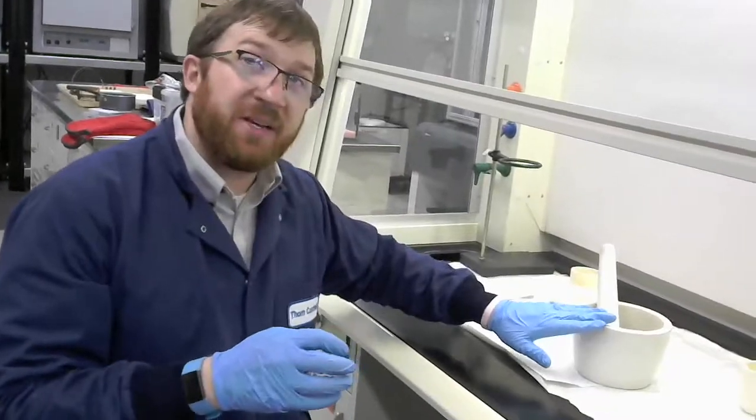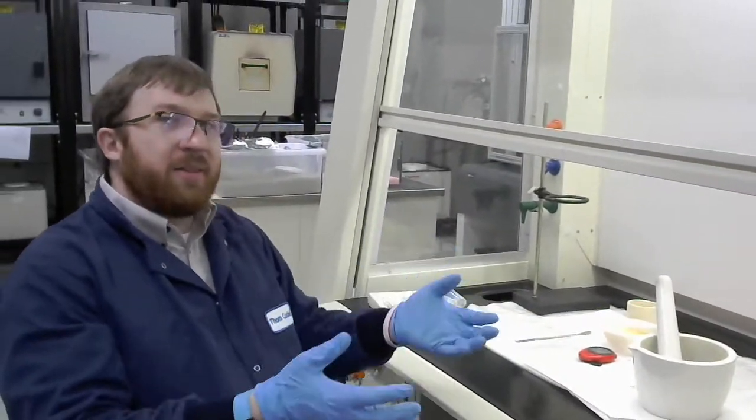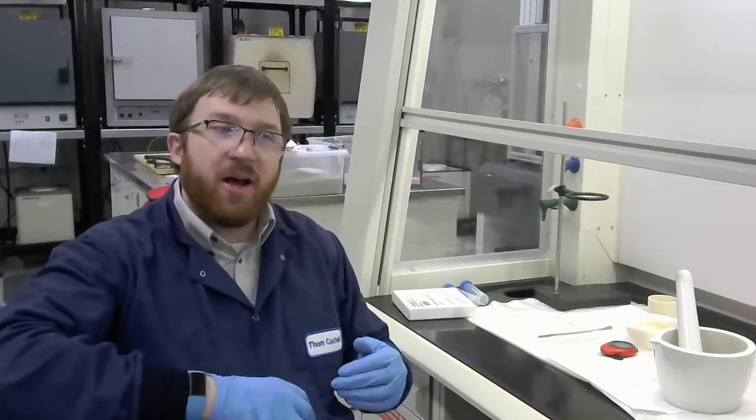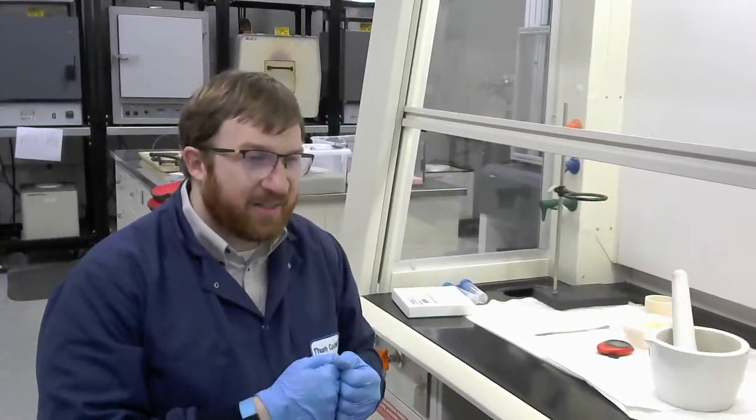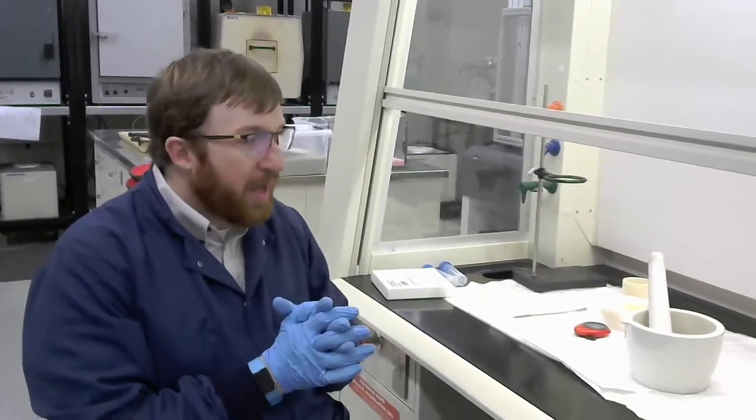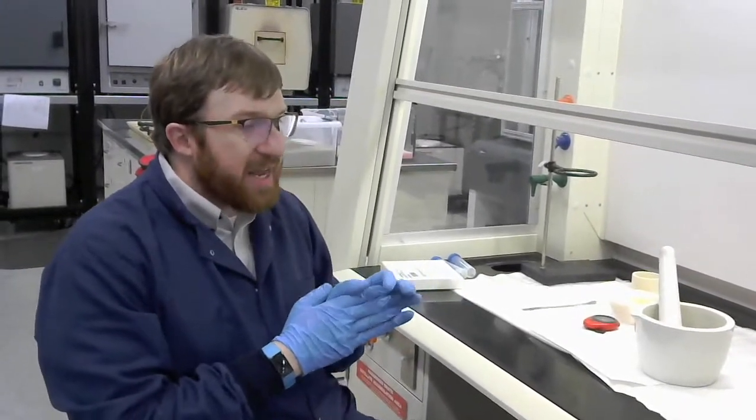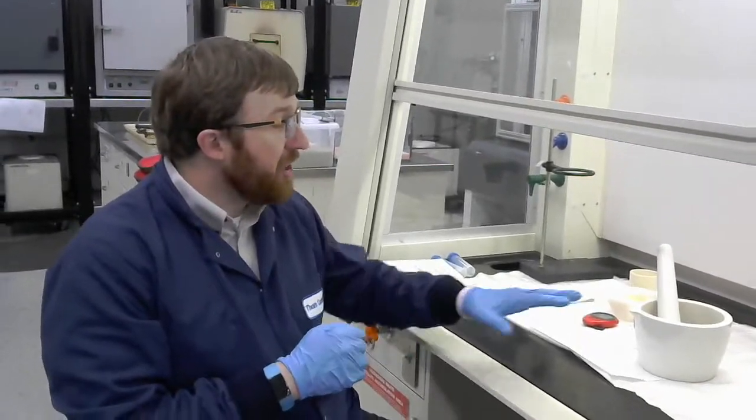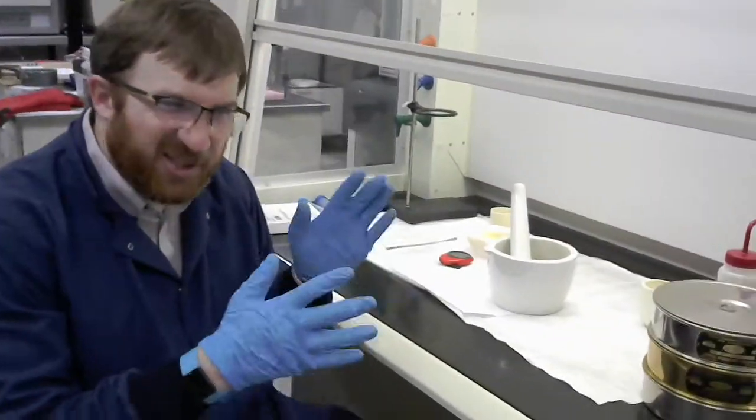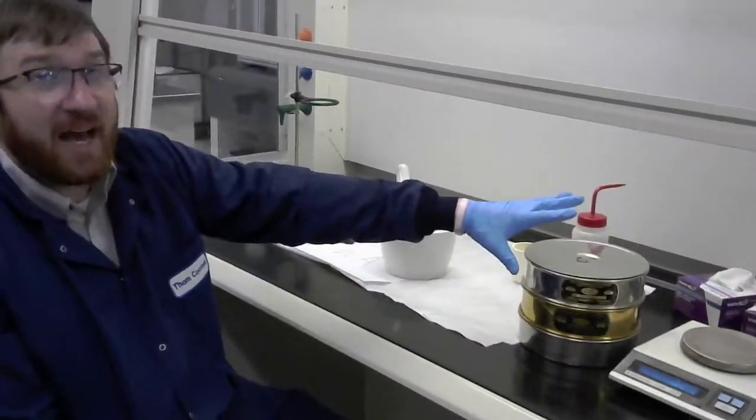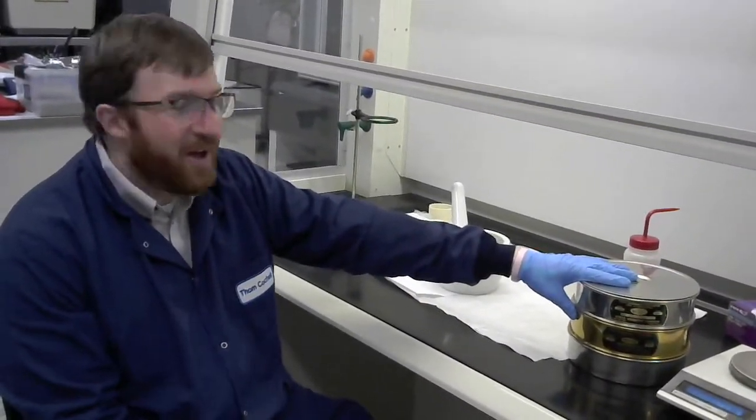And this is kind of just again from experience of knowing what level I'm trying to get down to in the powder. So typically if you see those sparkles, you still have a little bit to go. But I thought it would be a good time to stop here because this looks like probably the first part where we have some fraction of the powder that is down to size. So it doesn't all happen at once. So this is a time we'll take to see what we have. So I'm going to stop now. I think I stopped the stopwatch already. Again, 15 to 20 minutes.